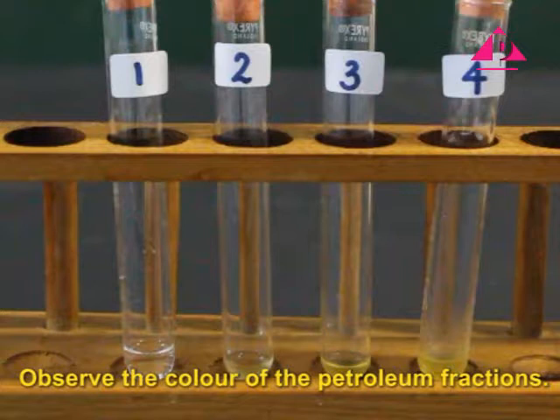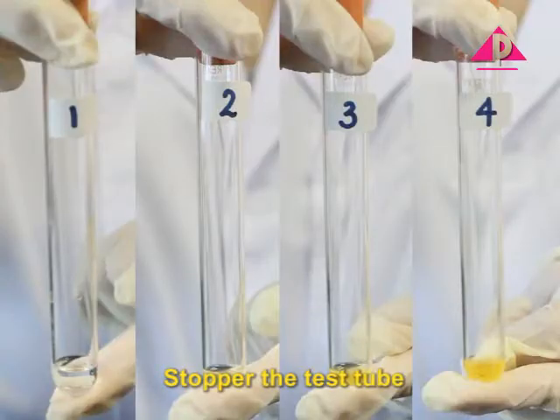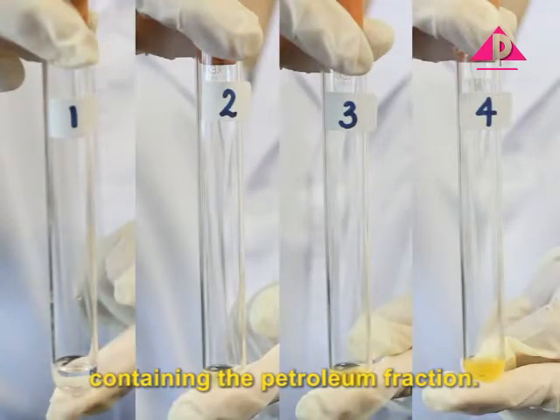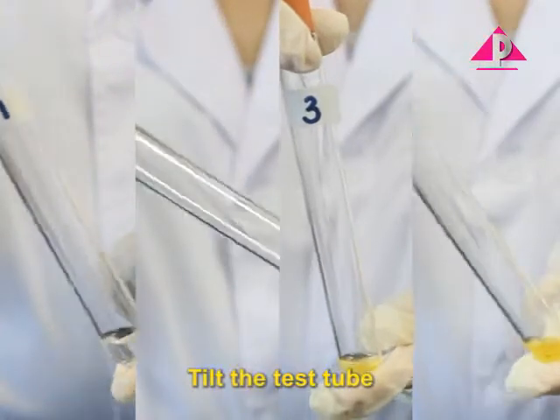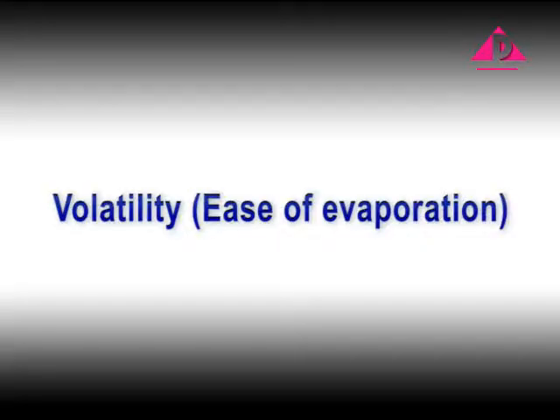Observe the colour of the petroleum fractions. Stopper the test tube containing the petroleum fraction. Tilt the test tube and see how quickly the fraction flows.